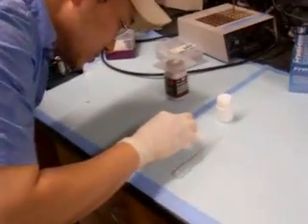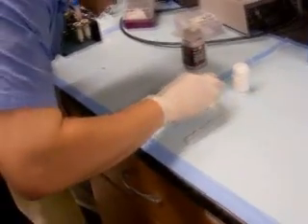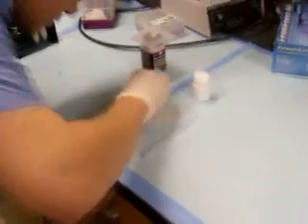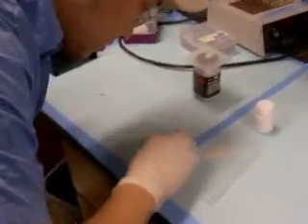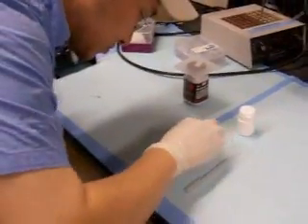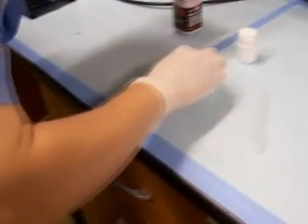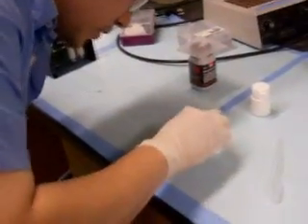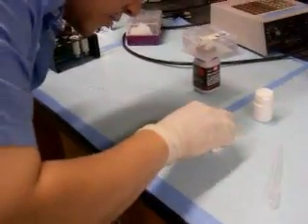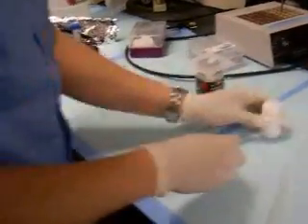I'm trying to keep this to a localized area here. Yeah. Oh, got a battery low signal on the camcorder. I think we're still okay for a certain period of time. Okay. I have now rubbed the contaminated surface with the Mercury Resorb rod intimately using a procedure. You see a counterclockwise motion.